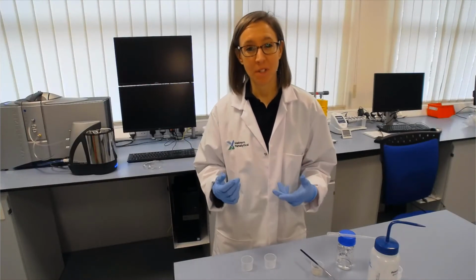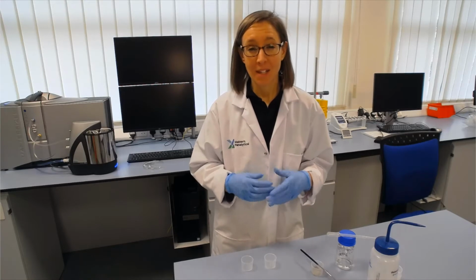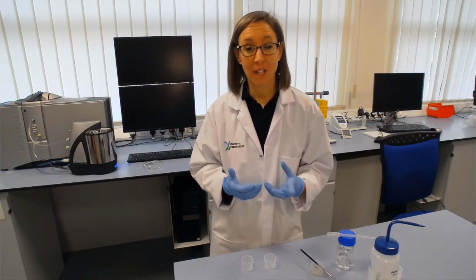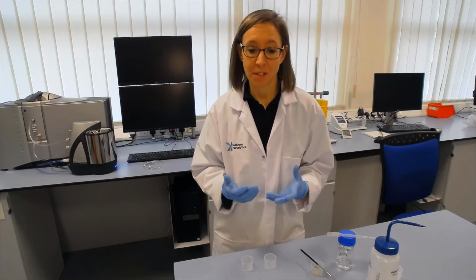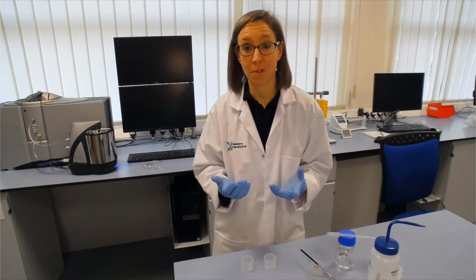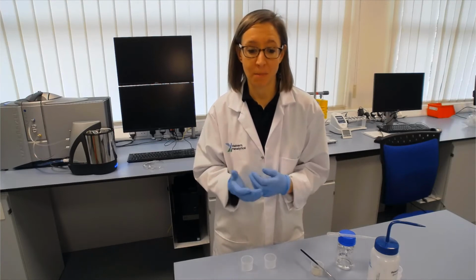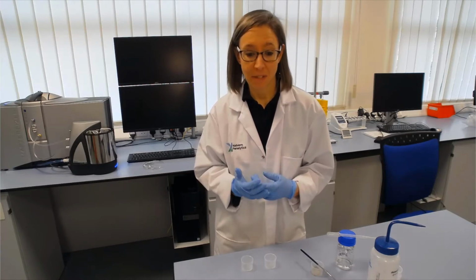When we're dispersing a powder into a liquid, the first thing we have to do is choose what liquid we're going to use to disperse the sample. It needs to be clear and free of bubbles and not too viscous, but importantly what it has to do is wet the sample. The simplest and the cheapest thing to use is water, but you might find that you need to use some surfactants to reduce the surface tension between the water and the sample to help disperse the particles. So the first thing we'll do is a wetting test in a beaker.